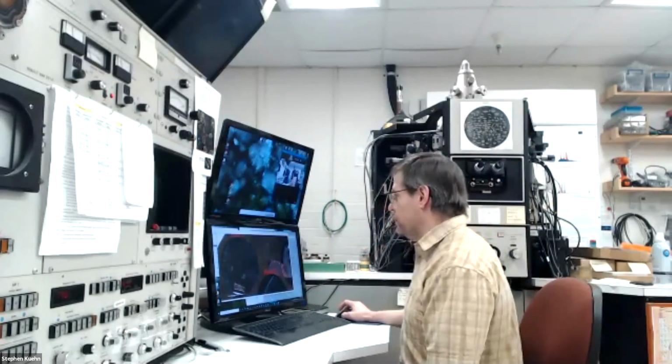Maybe you've seen those kinds of things before from an electron microscope. It turns out we can actually combine those 2 things together. So we can do the scanning to make a picture, but also collect the X-rays at the same time. And so that is what we're going to be using today.